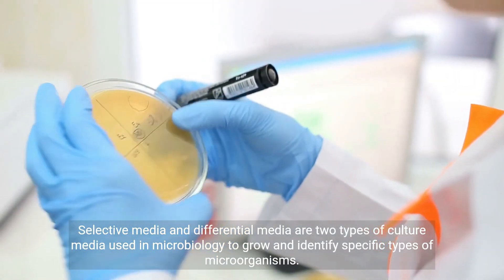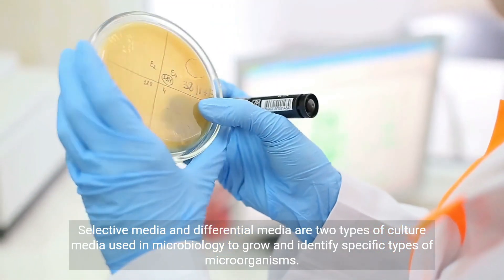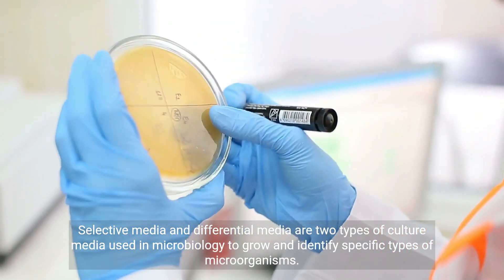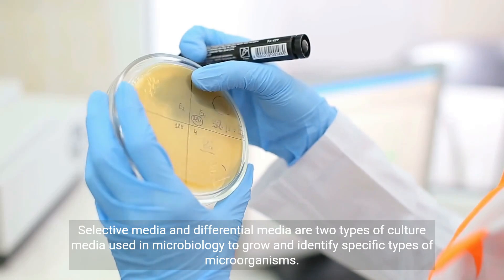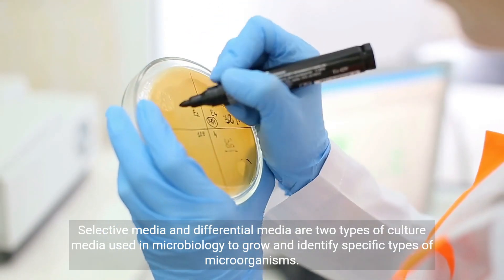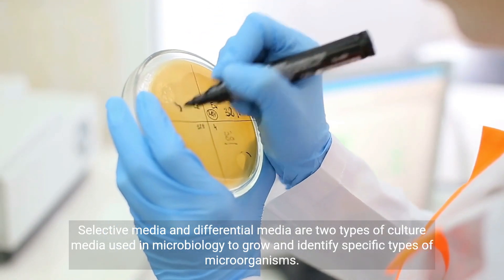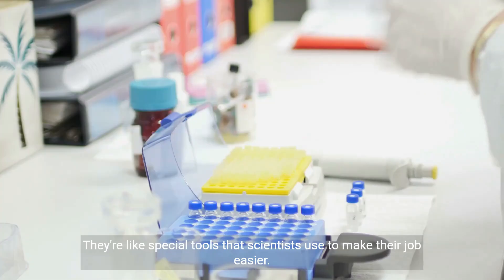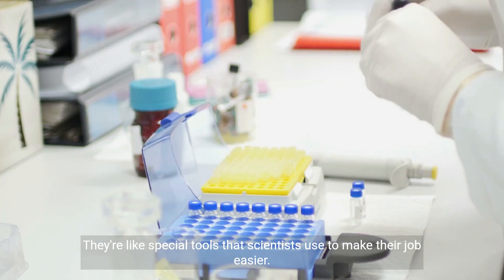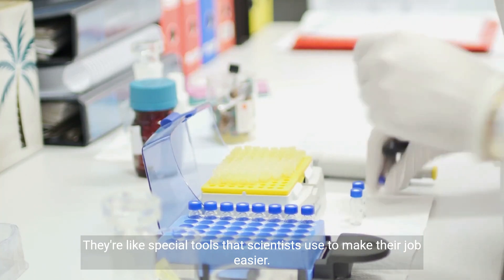Selective media and differential media are two types of culture media used in microbiology to grow and identify specific types of microorganisms. They're like special tools that scientists use to make their job easier.